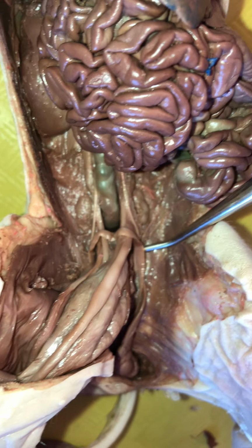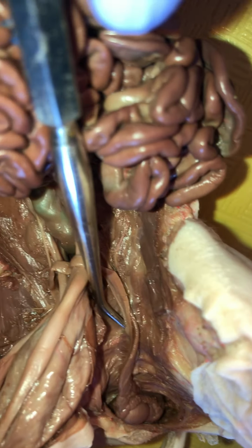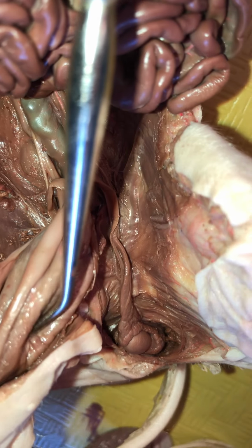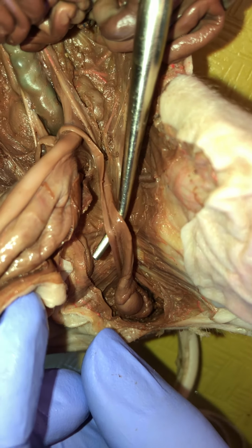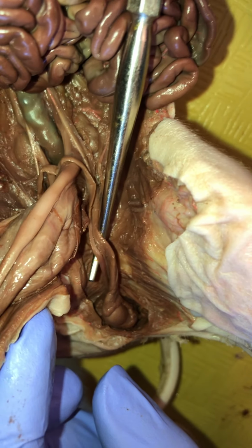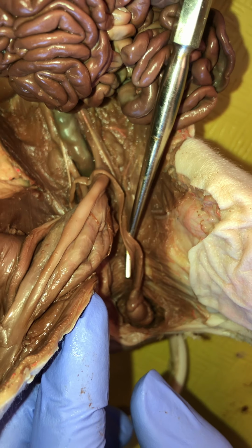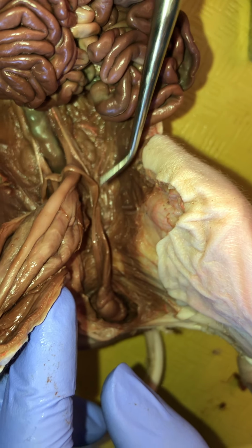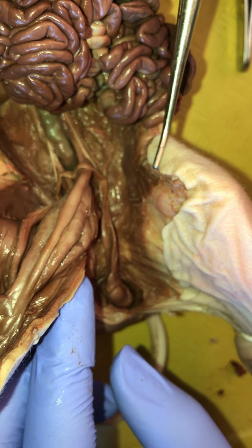All right, now, in addition to the vas deferens, notice that in the inguinal canal, we have this whole bunch. Oops, didn't pick up this whole, well, that's because somebody didn't dissect that. Let me get that. There you go. We have this whole bunch of, so we're going to have nerves, blood vessels, both veins and arteries and nerves, in addition to the vas deferens. And so the whole thing is collectively called a spermatic cord. So the vas deferens is part of the spermatic cord. And I think that does it.